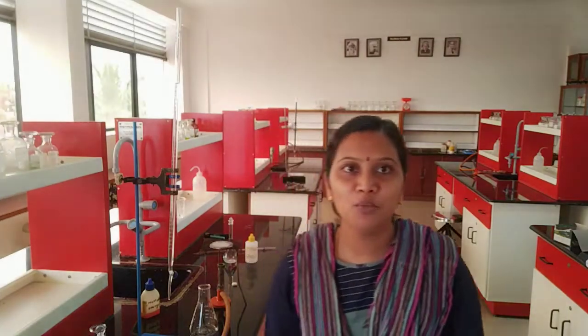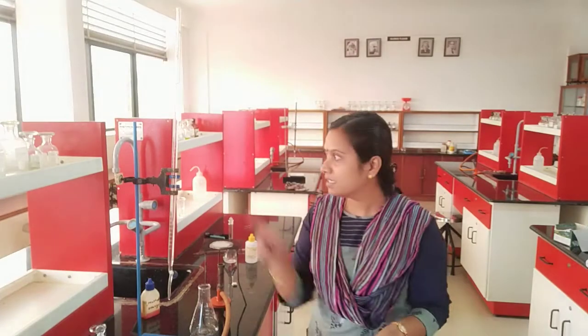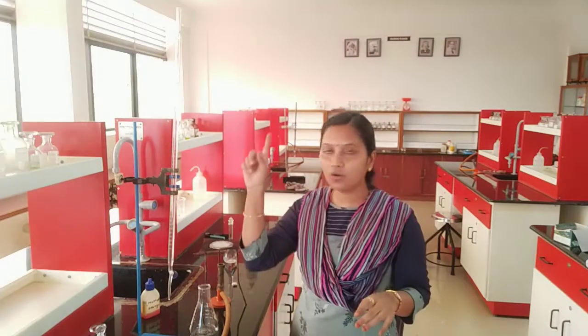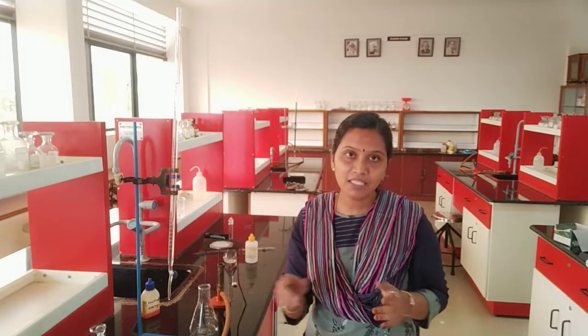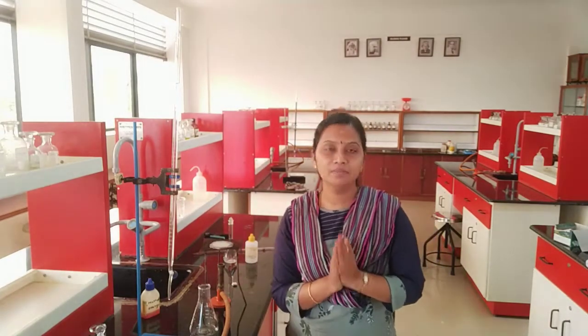So children, I am going to proceed with Experiment 4, the last experiment: titration of HCl against sodium carbonate.